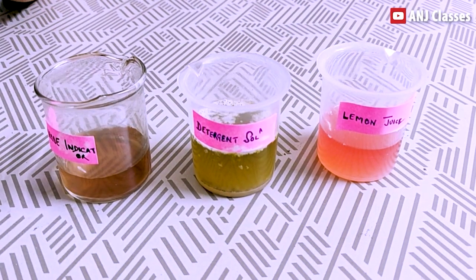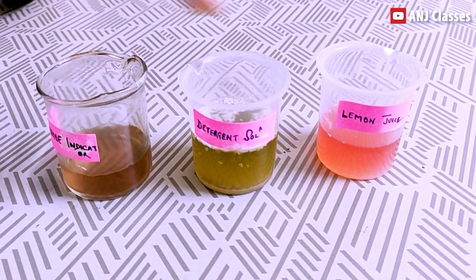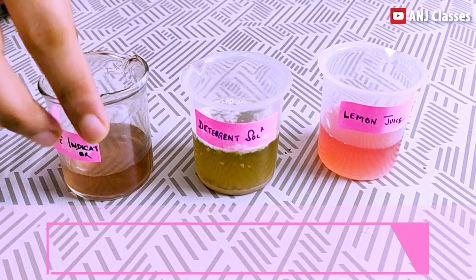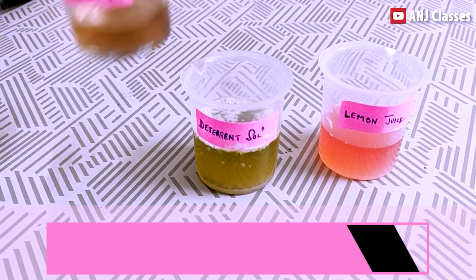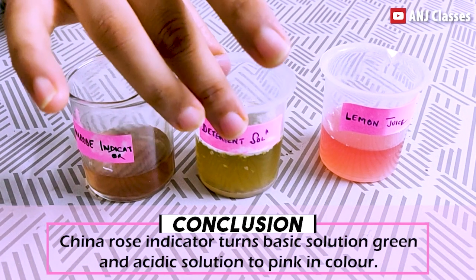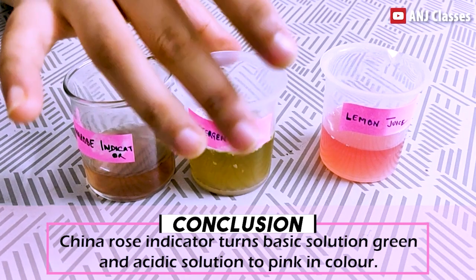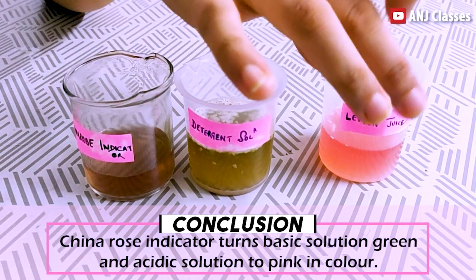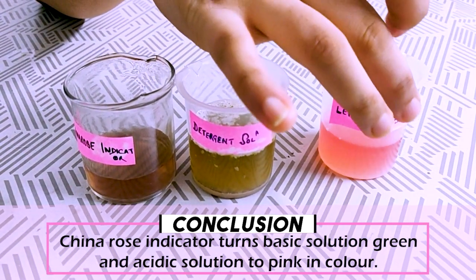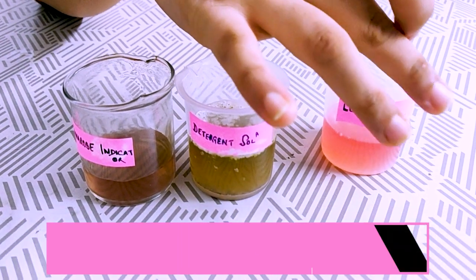From this activity we conclude that with China Rose Indicator, a basic solution turns green, whereas an acidic solution turns pink in color. Thank you students.